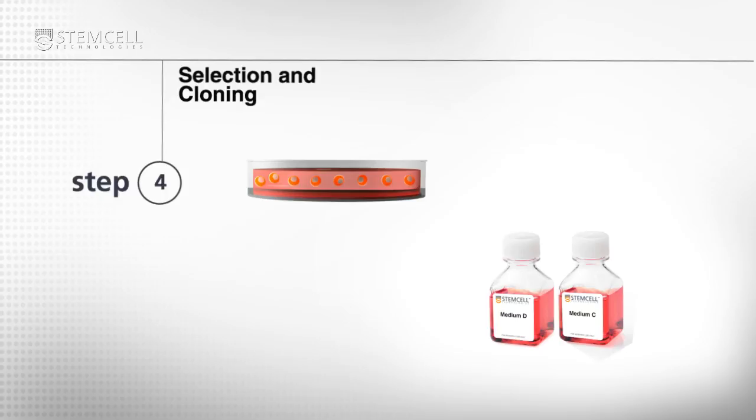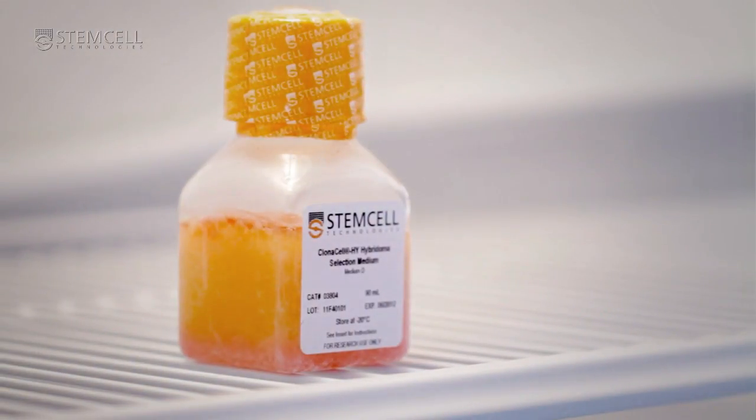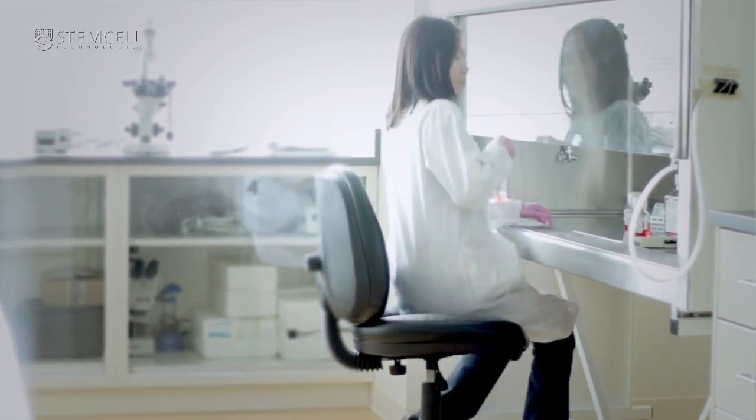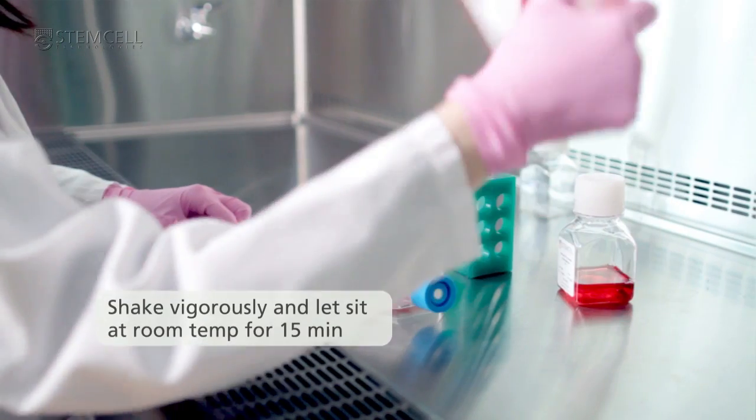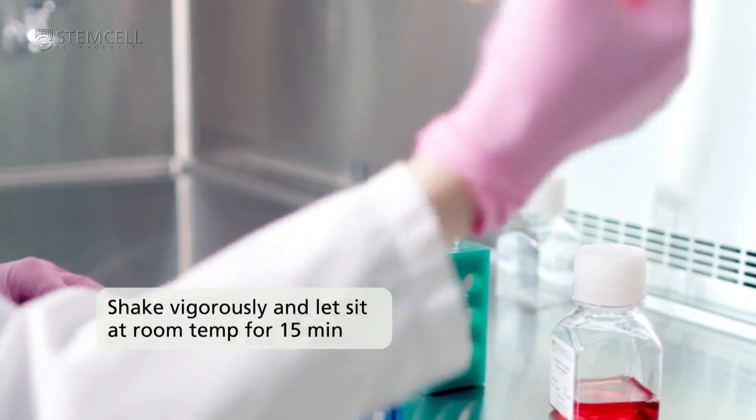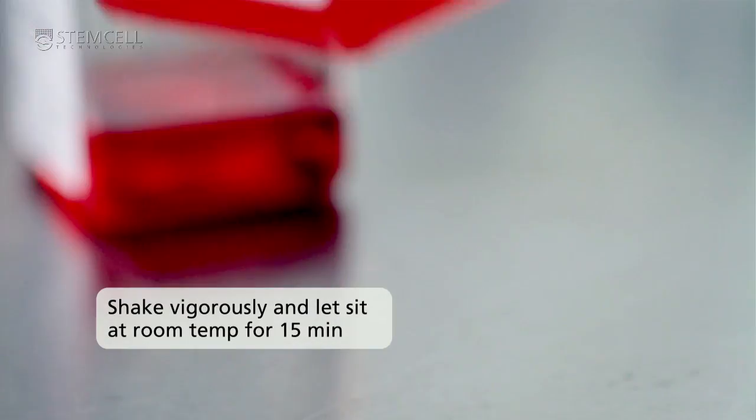Selection and cloning in semi-solid medium D are done after overnight incubation following the fusion. Prepare medium D by thawing in the fridge overnight. It will be required on the day after fusion. Shake vigorously and let sit at room temperature for at least 15 minutes to warm up and allow the bubbles to rise to the top.